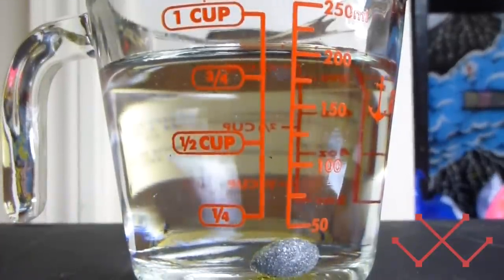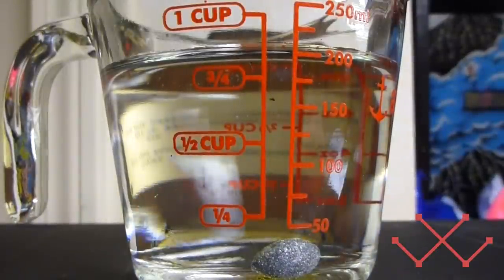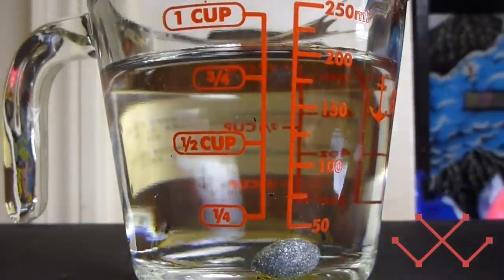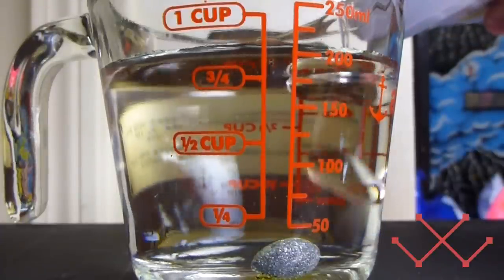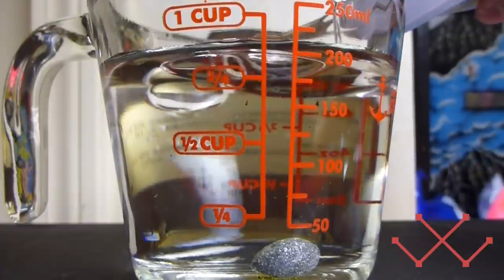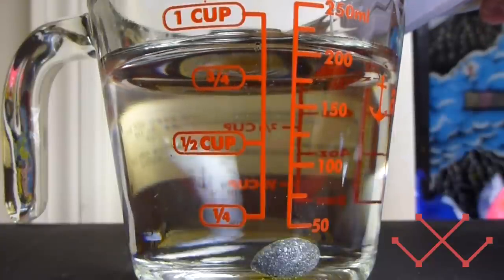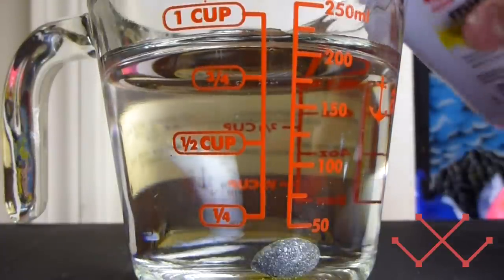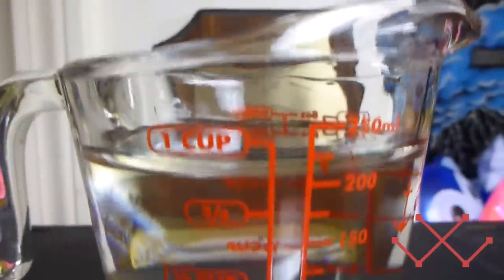The reason why I listed mineral oil as an optional component, is because I don't want the vapors to escape. So what I'm going to do, is pour a little bit of this in, to the top. Now, notice it's making a little film on the top. Let it spread out there.